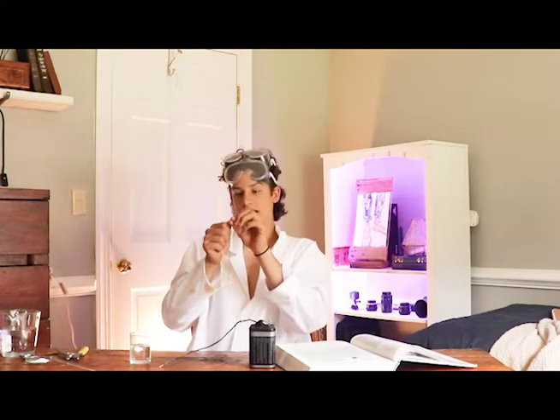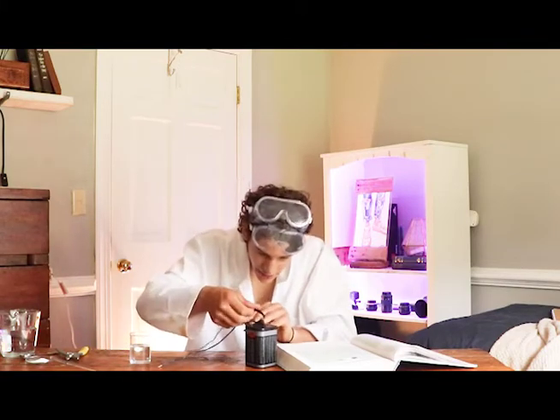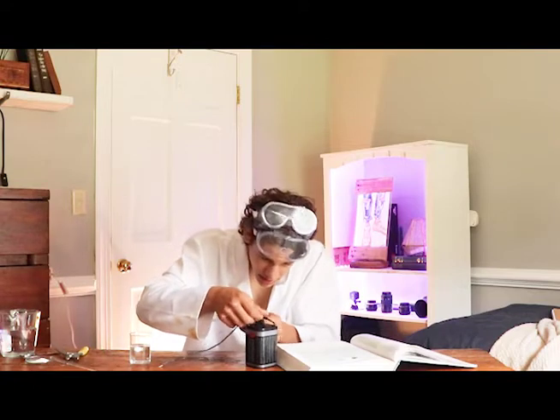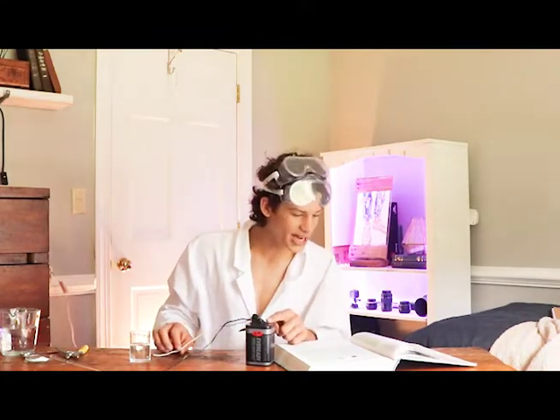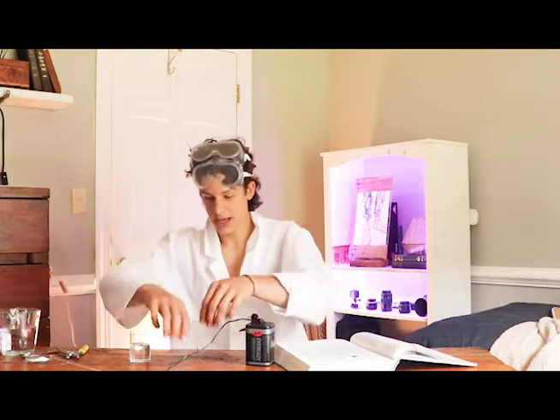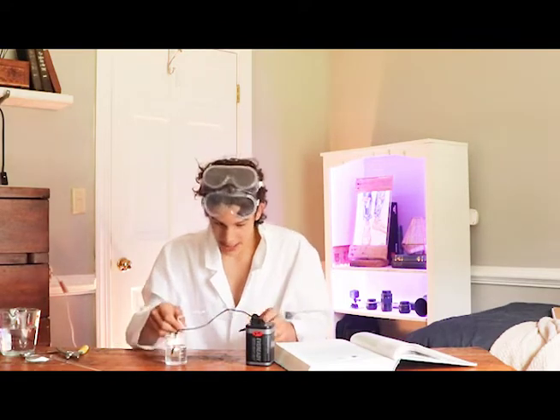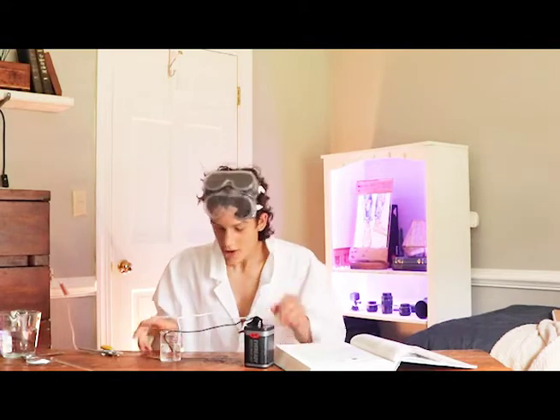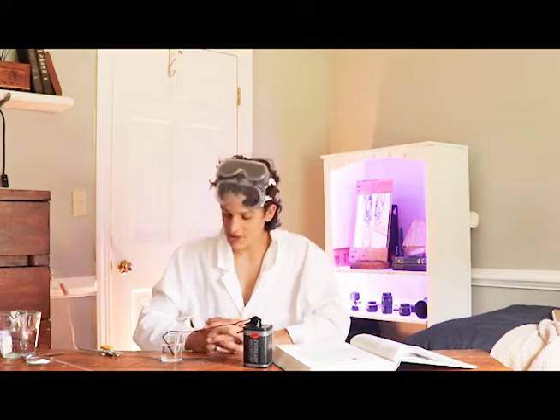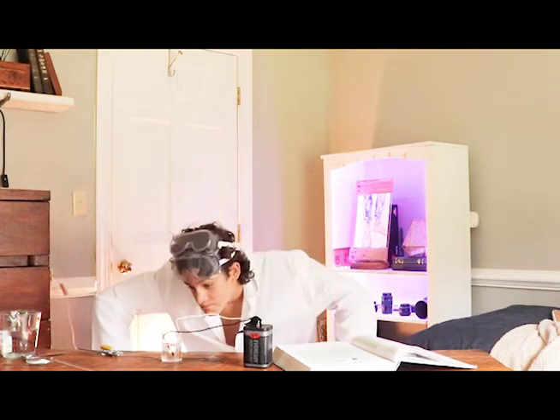Take your other wire, give it a little bend as well, and connect it to the other outlet. Take another piece of black electrical tape and secure it tightly onto the battery outlet. Now that you've connected both ends of your wire to the 9 volt battery, give your wires a little bend and place them directly into the beaker of distilled water, making sure you're still connected to the battery and touching the battery outlet. Now sit back and observe — which might be kind of boring, because as you can see, nothing's happening.